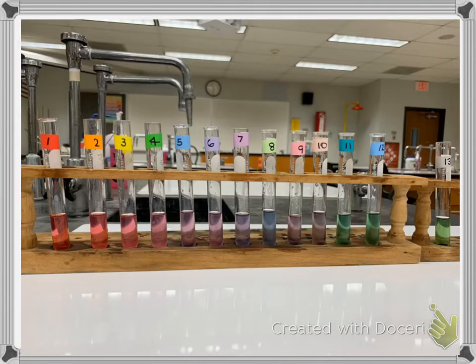So on this slide, I have all the colors again next to each other. It is very pretty. This slide may also help you if you were having trouble distinguishing. It might help you see the differences, but you can see why a lot of people like this lab in terms of just what it looks like. So that would be part A. We're trying to set up a reference scale, something we can compare our other data to. So this is our reference scale. I did not throw it out till I was done with the lab.